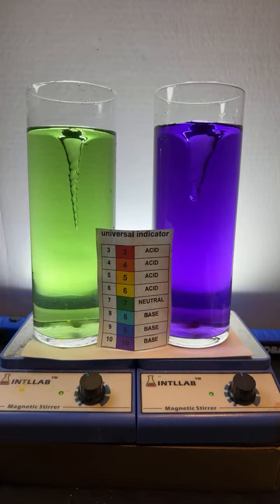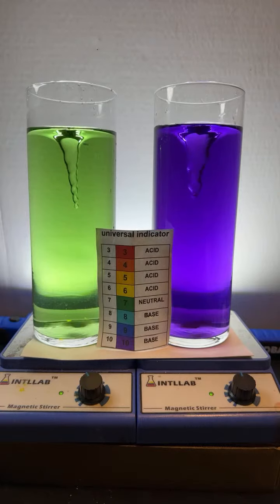Appreciate that. If you neutralize and drink, will you? Yes, I will, typical, because one of the dyes is a laxative. Left solution looks like the inside of a kiwi. I love it. Now add metal like zinc and see if it makes a pop sound.